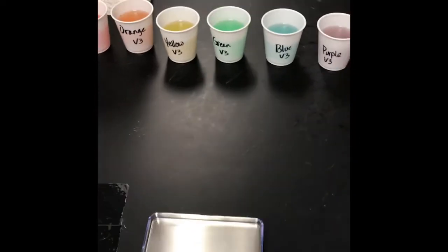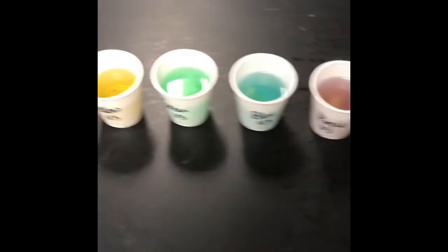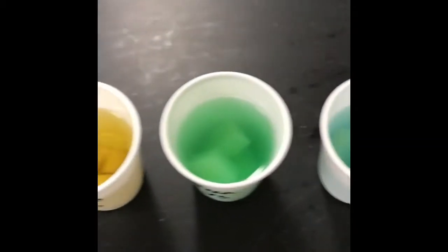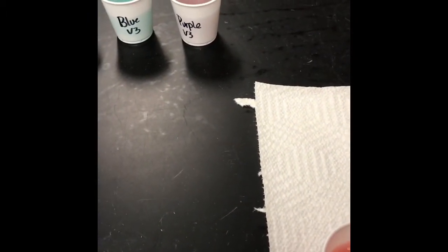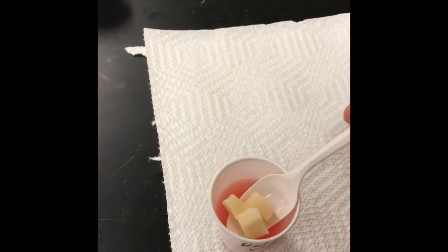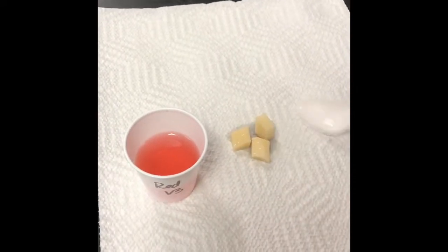Okay, now for the conclusion for part B of your lab from yesterday. These are your potatoes from yesterday. Look at that. Don't they look pretty in there? So we want to take the mass, take these out. I have it set up where I've got some paper towels and a plastic spoon, and we're going to start with a red cup and try to make the least amount of mess as possible because these are going to be grody. Okay, so I'm going to put on the paper towel, kind of let some of the water drain off.